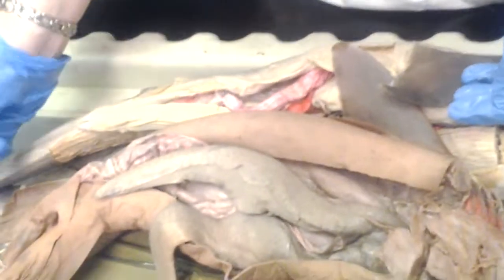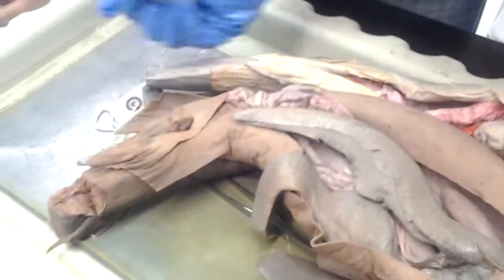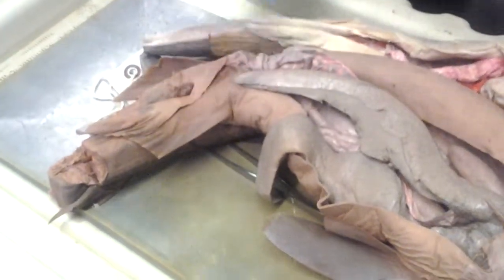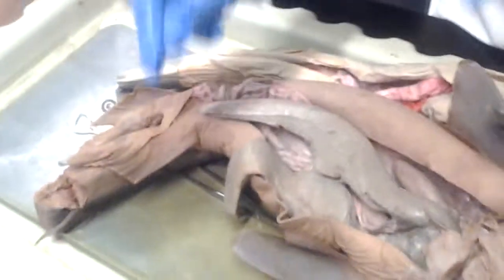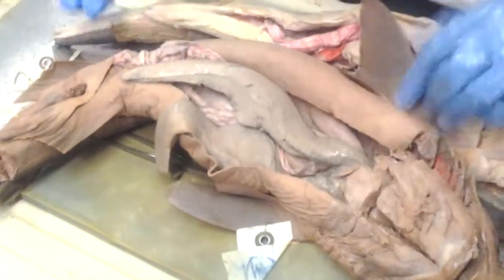Okay. So what else should we go over? Genital over here. How about muscles? Oh yeah, muscles. Actually, wait a minute. This is the siphon here, right. And this is the clasper, yeah. And this is the pelvic girdle. You can't see it. Oh, we should look at the skeleton, though. We should definitely take out some skeletons for a minute.